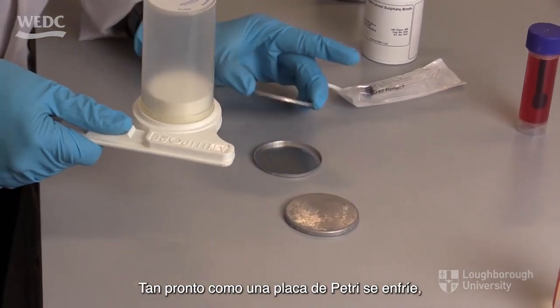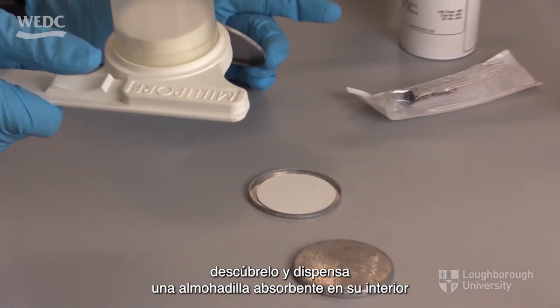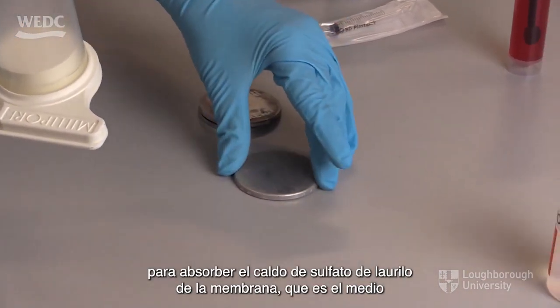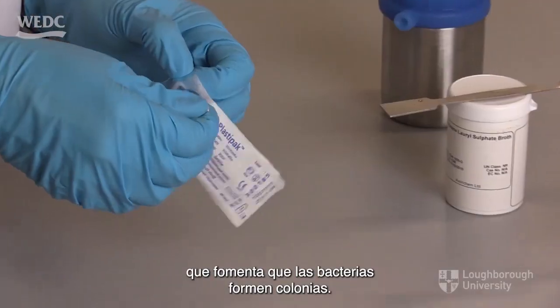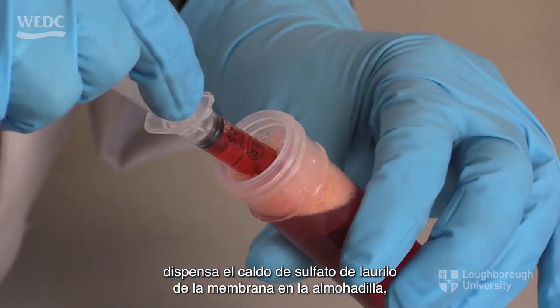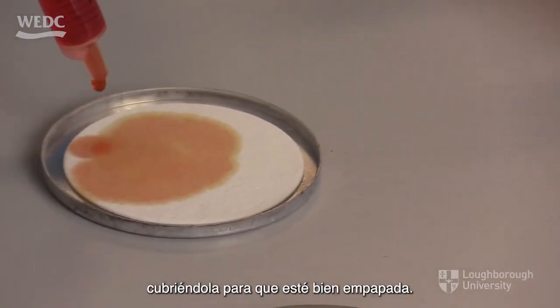As soon as a petri dish has cooled, uncover it and dispense an absorbent pad inside it to absorb the membrane lauryl sulfate broth, which is the medium that encourages the bacteria to form colonies. Using a sterile syringe, dispense the membrane lauryl sulfate broth onto the pad, covering it so that it is well soaked.